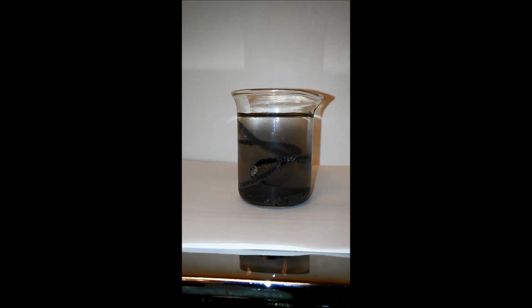But anyway, if you look closely here, and I know my phone's in the way a little bit, you'll be able to see it in better detail on the video later, but you can actually see that the paper clips are not as thin as they used to be, and that's because just like the copper metal with the silver earlier, they are getting a coating of silver on the wire. And if you watch, it's not sticking to the wire very well here the way it does on the copper, and so I'm actually seeing it rain off quite a bit. But if you look closely here, if you want to pop up now or when you get ready to leave, you can see bits where it is shiny, where you can see shiny silver crystals growing on the iron wire there. And I just used paper clips for the iron wire here.